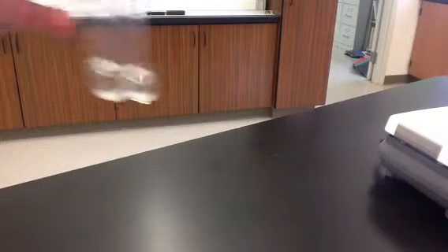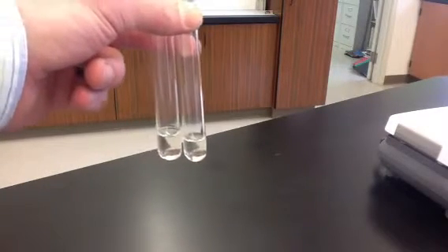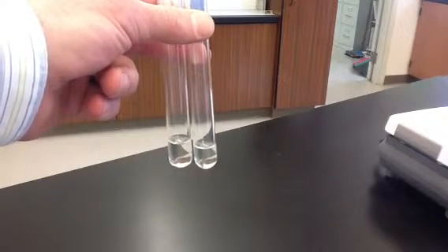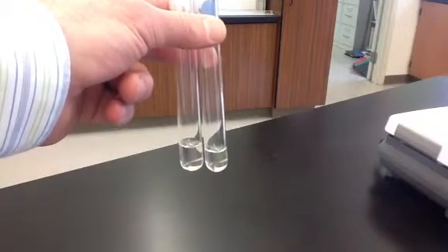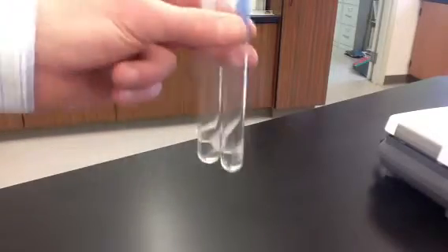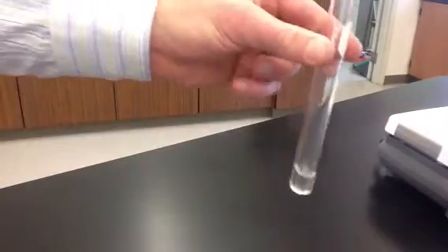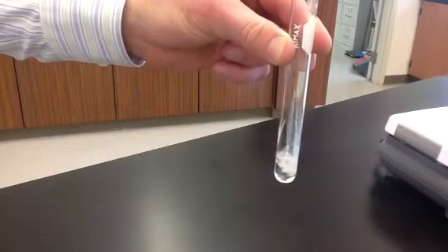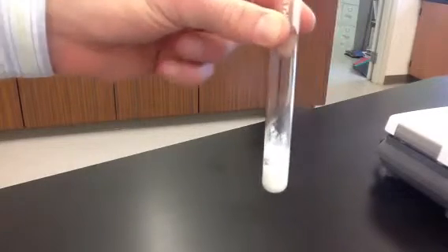Our next reaction will be between lead nitrate and sodium hydroxide. So these are both aqueous solutions. Lead nitrate is soluble in water. Sodium hydroxide also soluble in water.